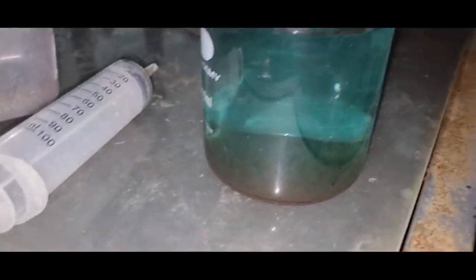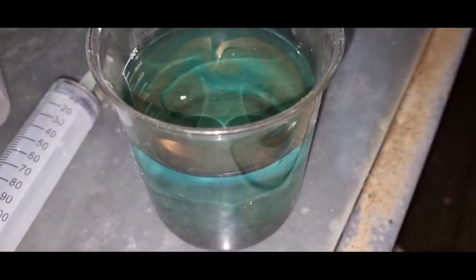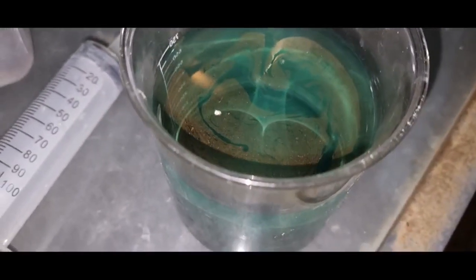I'll now decant this liquid so it's just the powder and then wash with water three or four times and then we'll dry it and weigh up the gold and see what we've got.